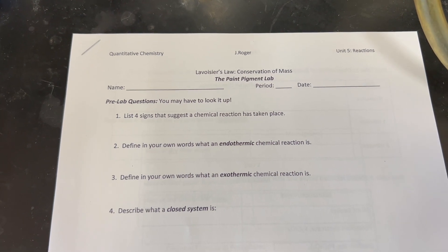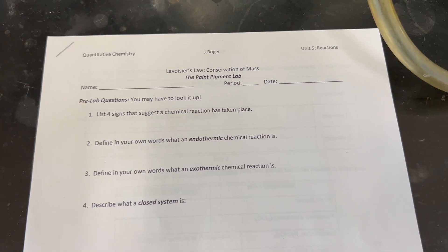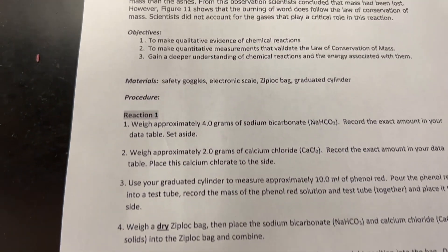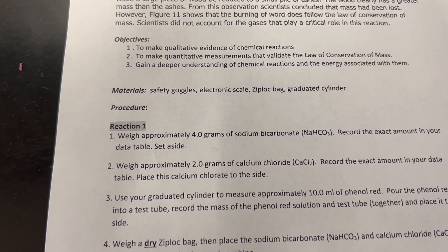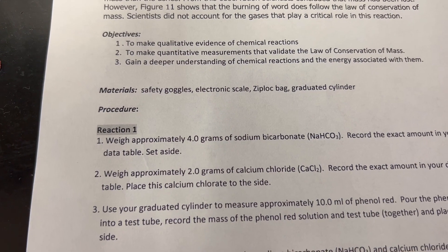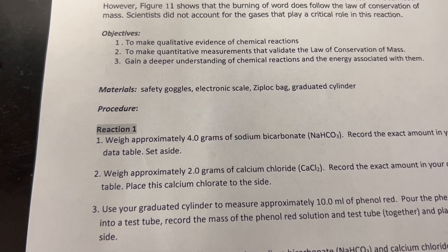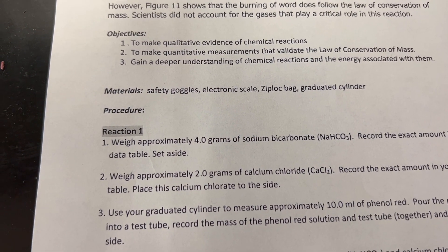Essentially we have three objectives here. The first is to make qualitative evidence of chemical reactions.